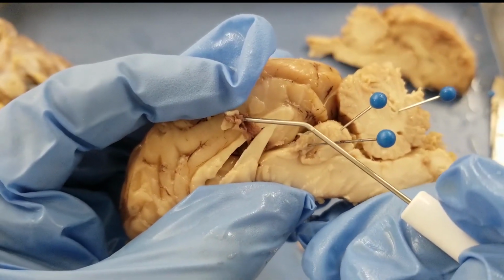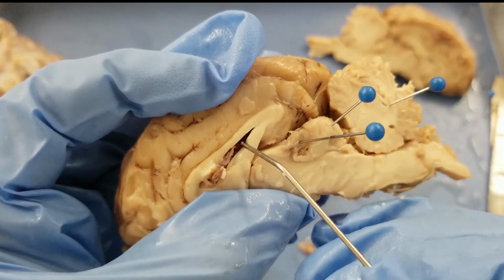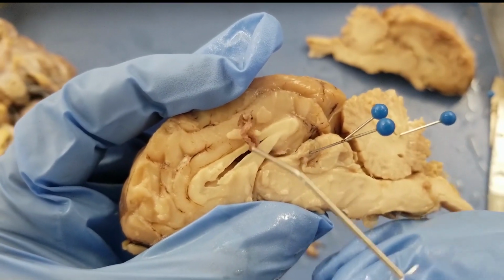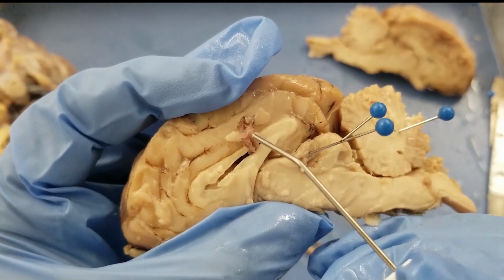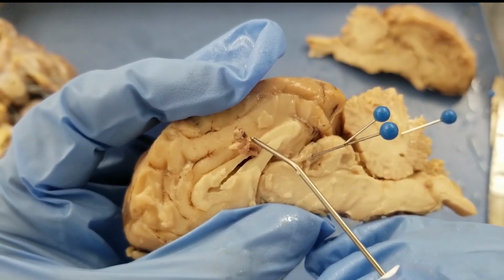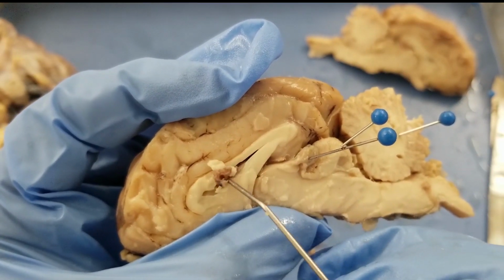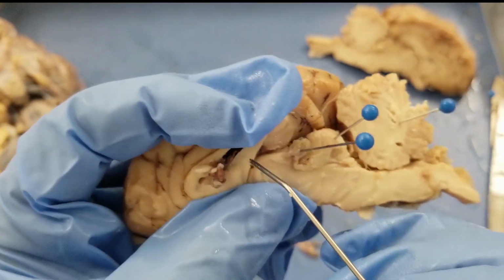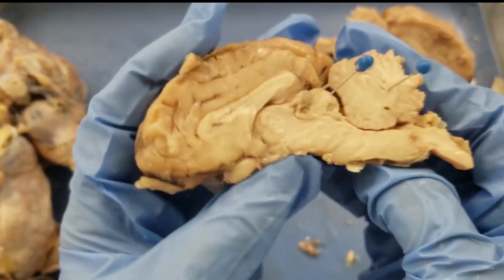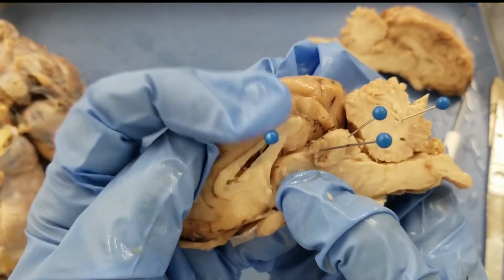And inside the lateral ventricle, you'll find something like this. Ew, what is that? That is a blood vessel. Why do you have a blood vessel inside the lateral ventricle? Because that is how CSF gets into the lateral ventricle. CSF is basically the plasma that gets out of your blood vessel and diffuses into the space. In the lateral ventricle, you have the CSF. Oh, I need to pin that. So that is the lateral ventricle. Yeah, it's a space, right? You're supposed to have CSF in there when the sheep was alive.